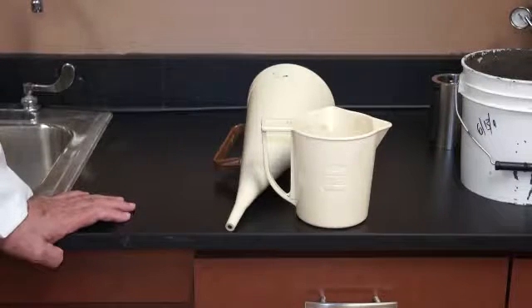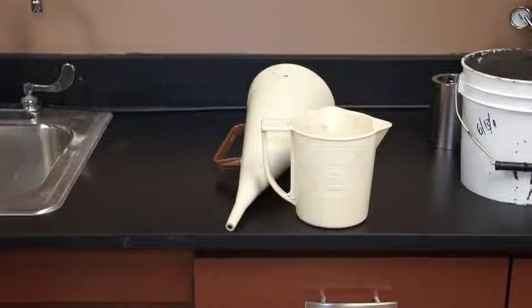People try to take the ratio. They say 43 seconds is to X as 26 seconds for water is to 1, specific gravity of 1, and you do the ratio out and you get a number. But then you put the same fluid in a rheometer, and you'll get a different number. So they're really not correlatable. Again, this is just a relative viscosity, but for what it does, it works very well. There are thousands of these that have been sold, tens of thousands, probably hundreds of thousands. And its beauty is its simplicity.